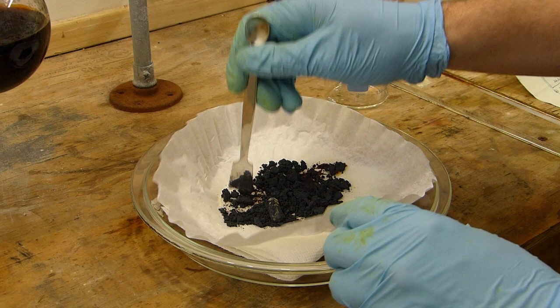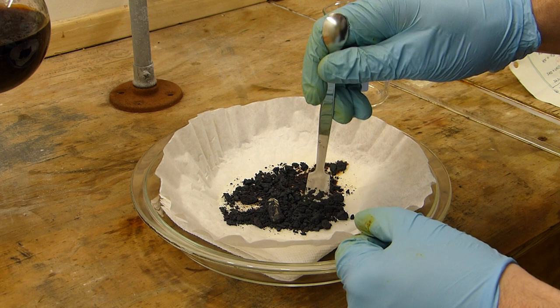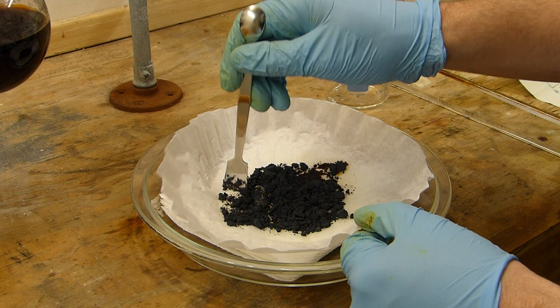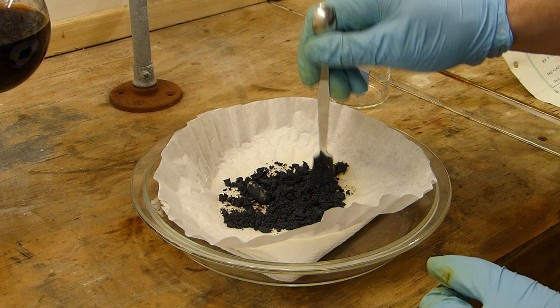It does sublime at room temperature so you will eventually lose it. So if you leave this overnight you're going to lose almost all of your product. So what you've got to do basically is just leave this out for maybe an hour or two. And keep it spread as thinly as possible throughout that hour.